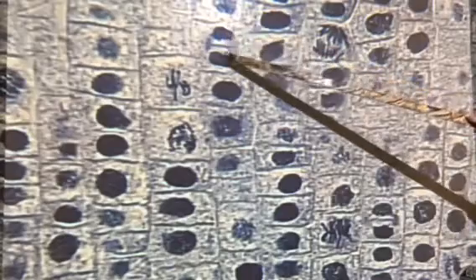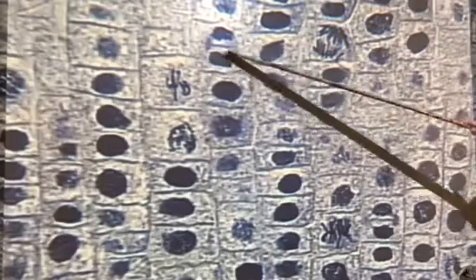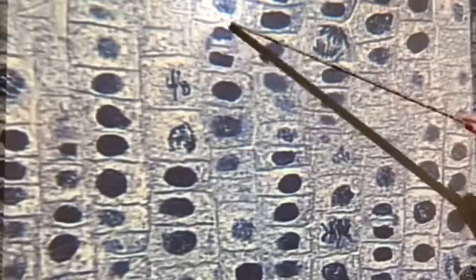Okay, now the next one is telophase. So now I'm looking for one that looks like it just split. The nucleus is starting to come back together around each identical copy of its chromosomes, and the cell wall is starting to form. These ones are tough. You kind of have to train your eye to see this. And I like two cells on here. I think these ones just went through anaphase, and this one's nucleus is starting to get back together. This one's starting to get back together.